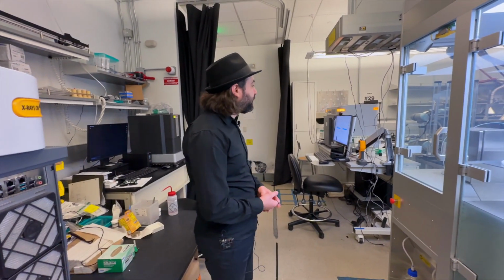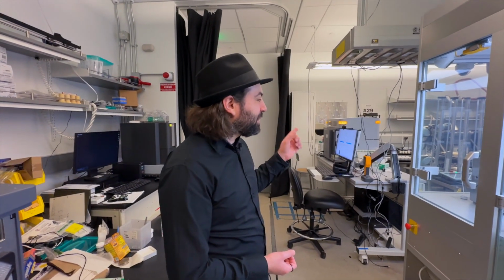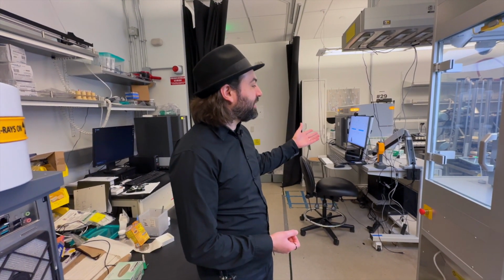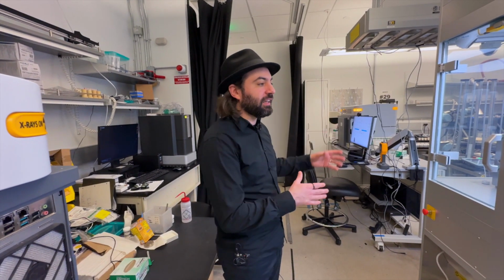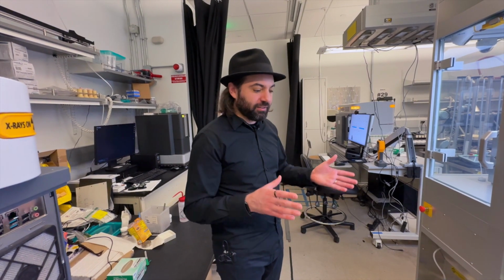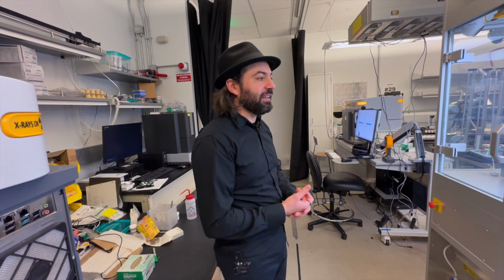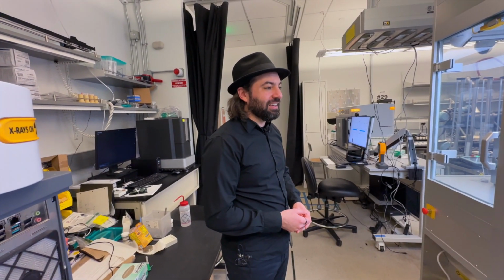Yeah. People from Universal Robots came. I'm pretty sure they're from Universal Robots, but some people from the robotic arm vendors came to visit us, and in the university where we are expanding the A-Lab, they are even providing training for us because we have this mobile robot and we need to learn how to use it. The experience is always great. It's very nice. I think engineers go well together.